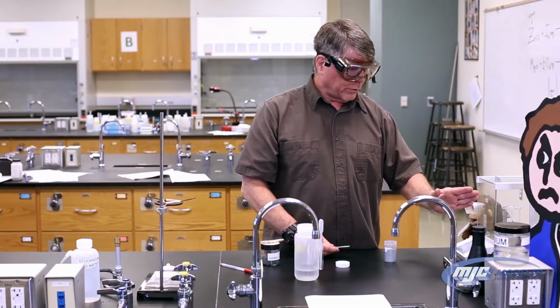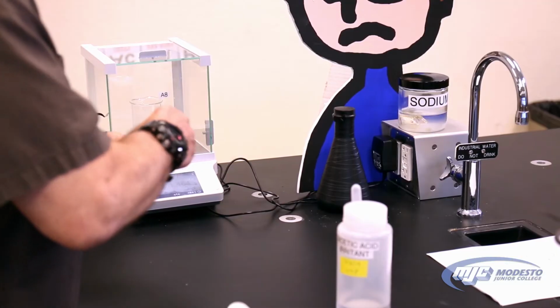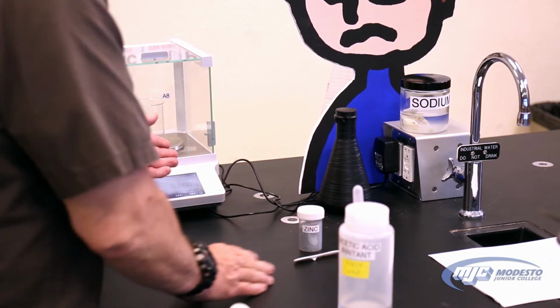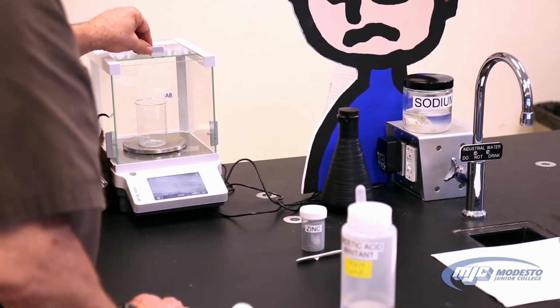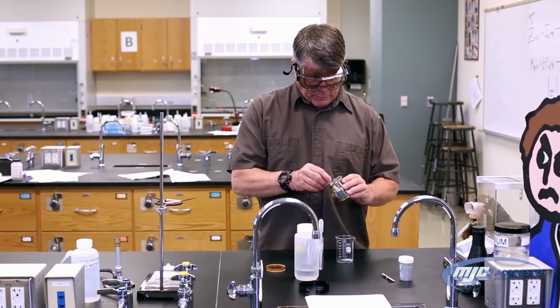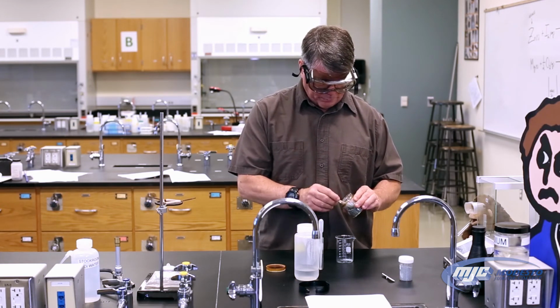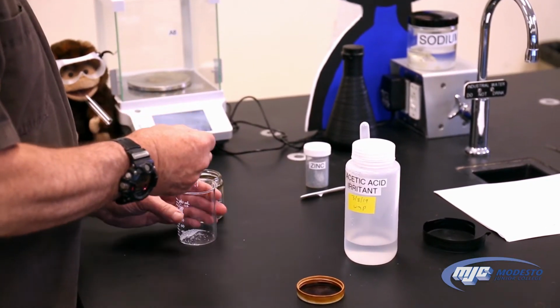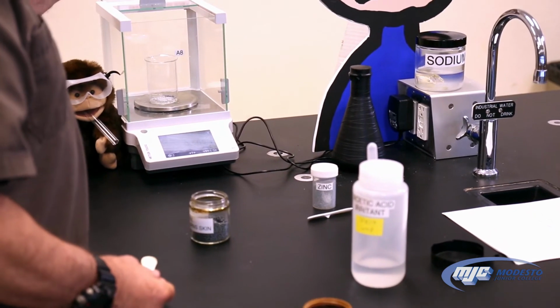Then with the beaker and the zinc on there, the next thing we're going to do is weigh out some iodine in there. So we need to tare out the balance once we get this mass. Now the balance says 0 with the beaker and the zinc on there, so take it off. We want to be careful not to add too much iodine because it will start reacting with the zinc once we put it in there. And these are little tiny spheres. It's probably less than you think. So add a little bit and then go back and forth till you get about 1.2 grams.